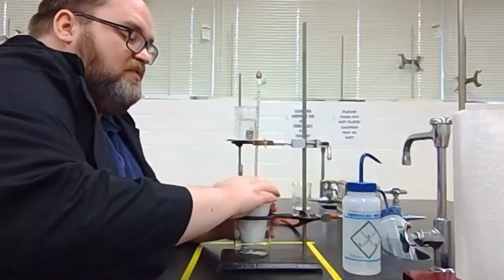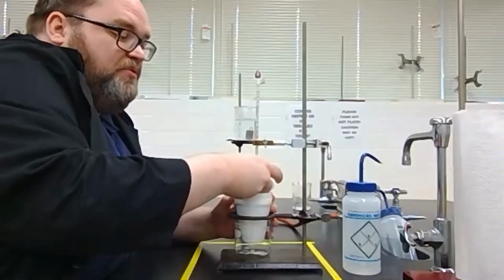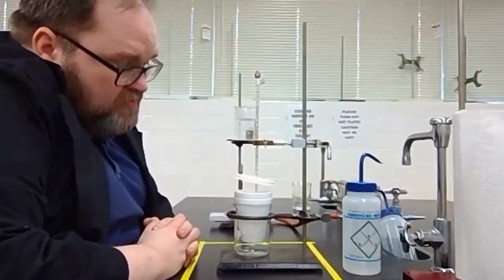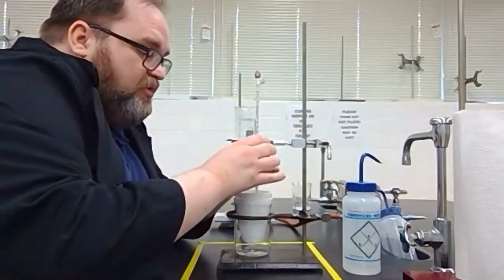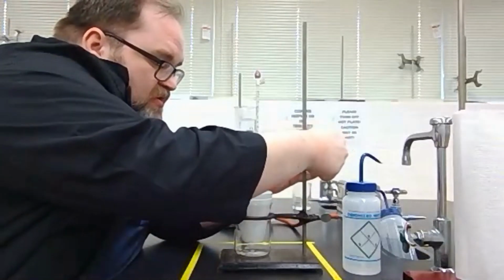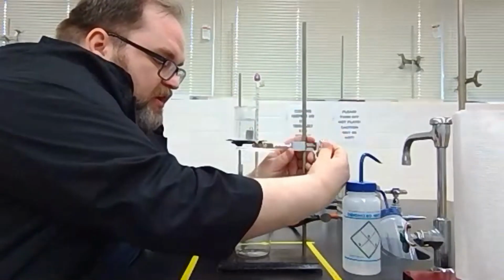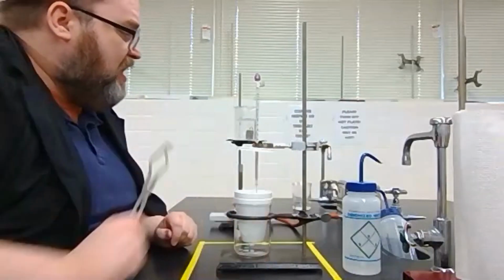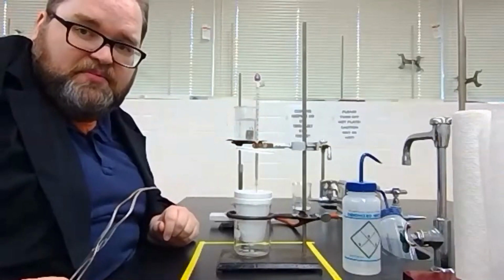So what we're going to do is I'm going to take off just the lid, and I'm going to stick it up. I'm going to start by reading the initial temperature of the thermometer. So right now it's sitting at 23.0 even. Set this up so that I can see in here. I'm going to make sure that the ball of the thermometer is fully submerged, which it is, and I'm going to lower that just a smidge. So we're right in the middle there. And then I'm going to put in my water and then close my coffee cup calorimeter.